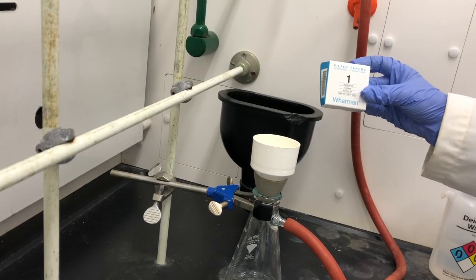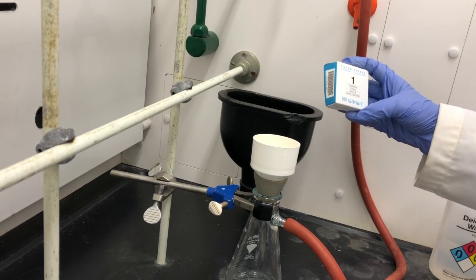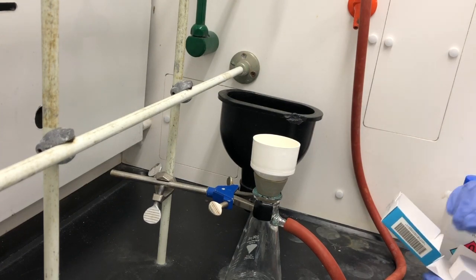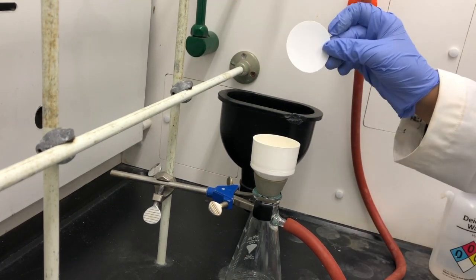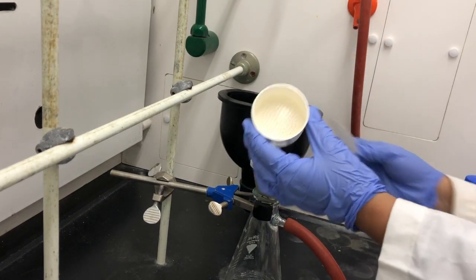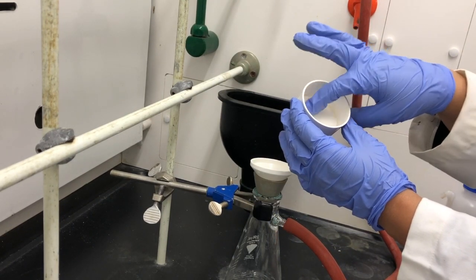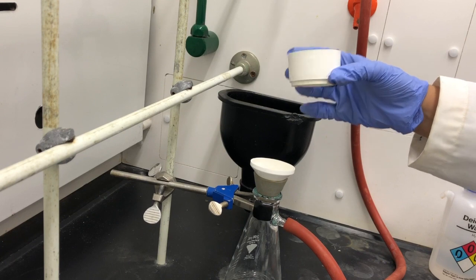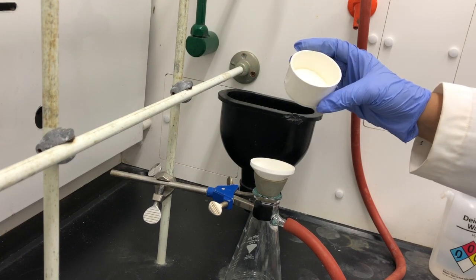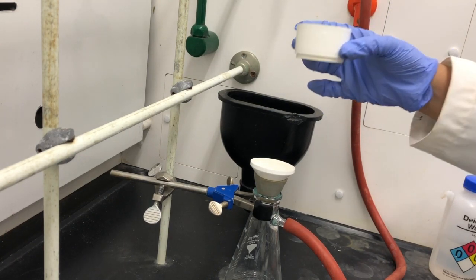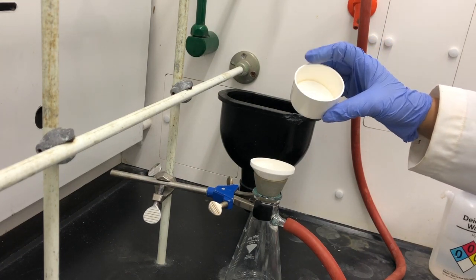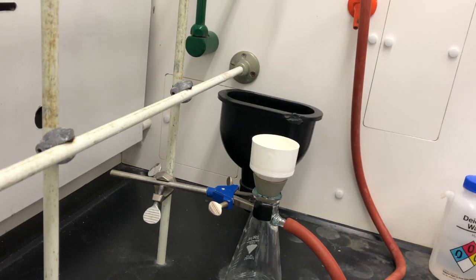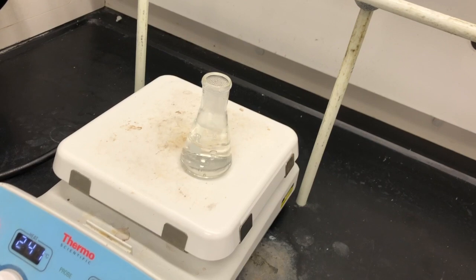And what we're going to do is add a filter paper. This filter paper, they come in different sizes. You want to make sure it fits right within. If you slightly release it, you'll notice that's where you'll filter. You can either weigh the filter paper on its own, or you can take the top of the Buchner funnel and weigh it out. It would sit right perfectly on the balance. And then at the end, when you collect the product right in here, you can re-weigh it once the product is dry. It's the actual weight of the product.